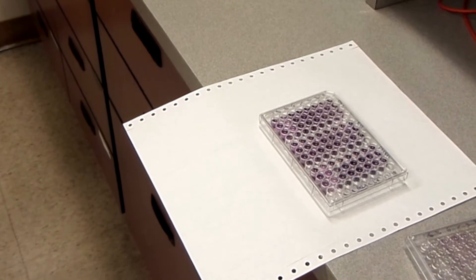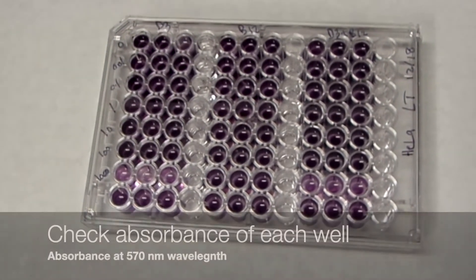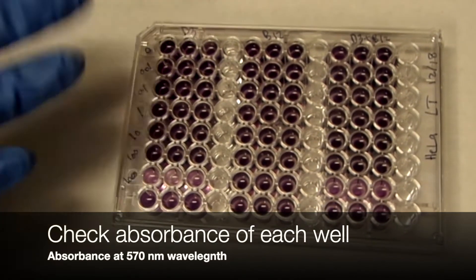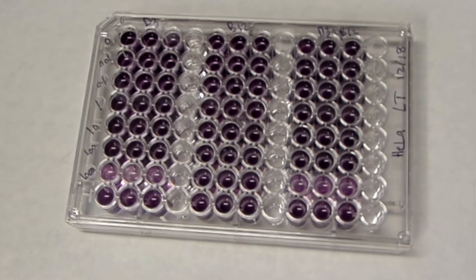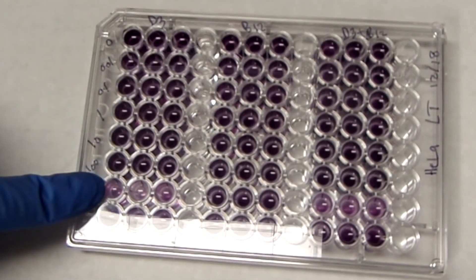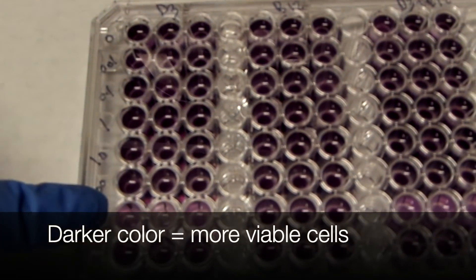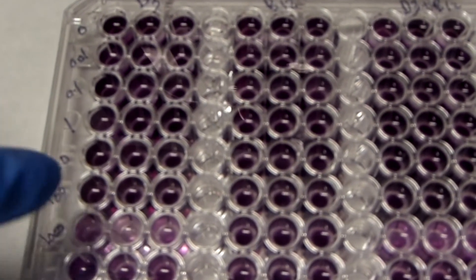After 45 minutes of incubation with the DMSO and isopropanol solubilizing reagent, we measure the absorbance of the plate at 570 nanometers — the absorbance of the MTT salt after forming the formazan crystal and being solubilized. You can see the difference in colors: comparing wells with the highest concentration of treatment to lighter-colored wells indicates that there are more viable cells in the darker wells. You need a microplate reader to do this — ours is old, but it still works.